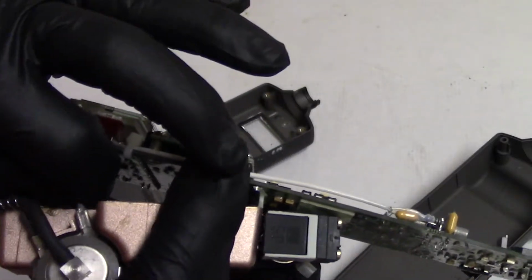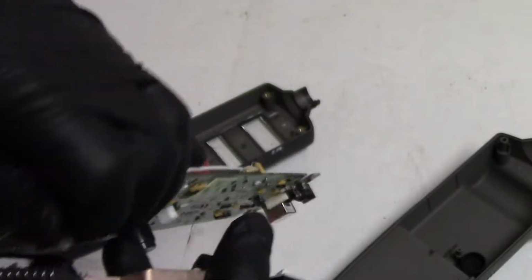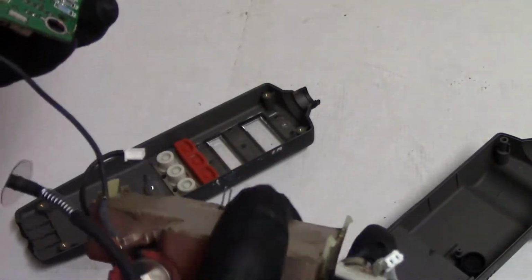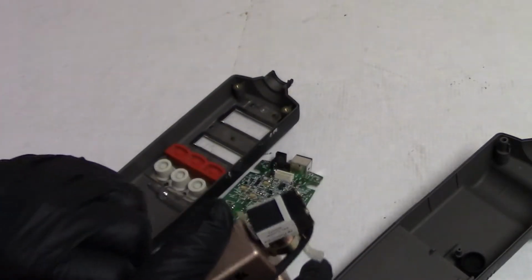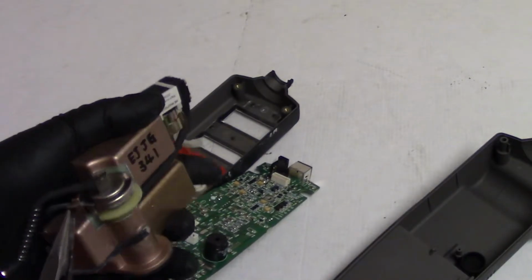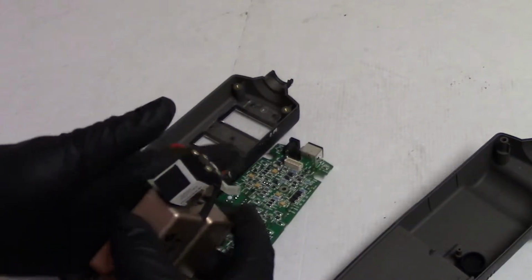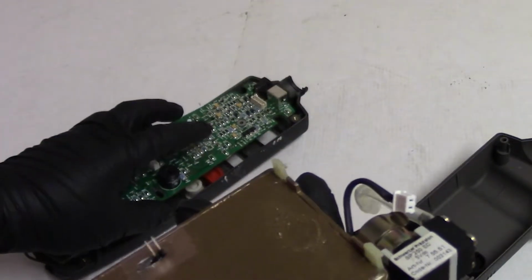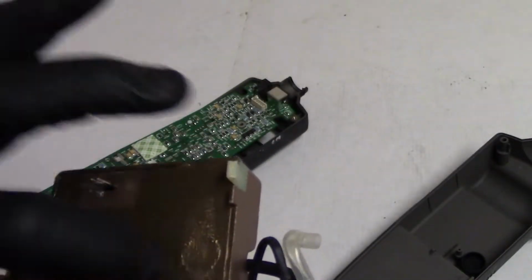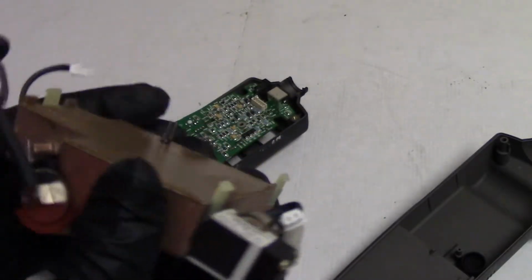Then we'll unplug the, yeah, that's high voltage. It's probably doing negative high voltage, would be my guess. I think I read 125 volts negative on some of these as a common voltage used. Let's get the ground off too. There we go. I'm just going to set that here. So that's the detection thing. Now, I don't know if that opens.